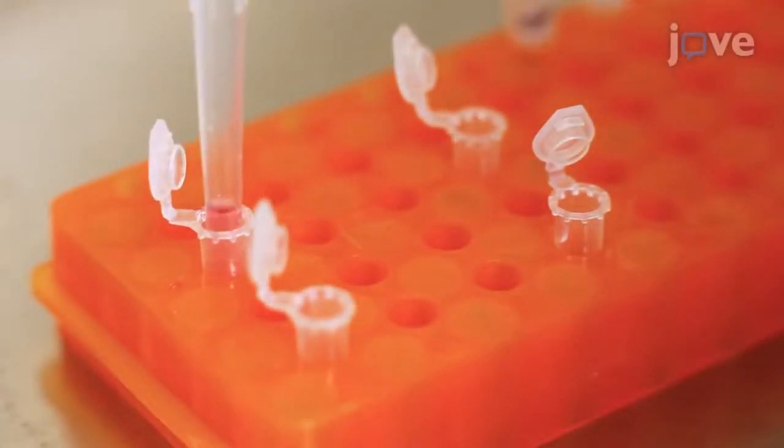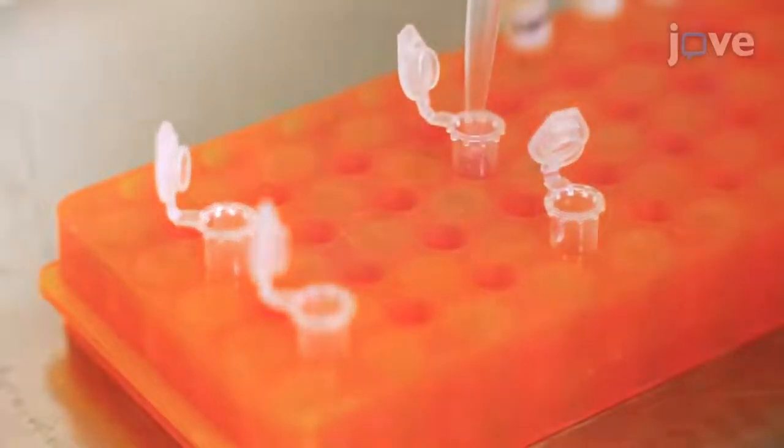Combine the diluted small interfering RNA with the diluted liposome reagent and mix gently.